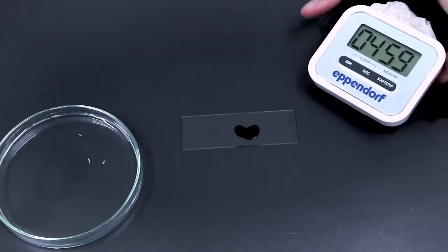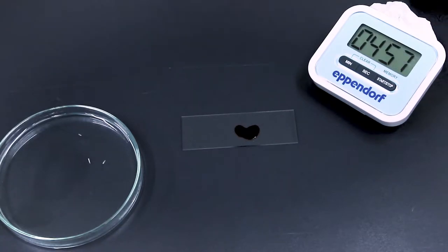The dye is going to penetrate into the cell and we want it to go inside the nucleus to stain the chromosome. At the end we're going to get like pink or purple chromosomes. You have to leave it like five minutes. At the end of this, because they don't have a cell wall now, the dye can go inside the cell.